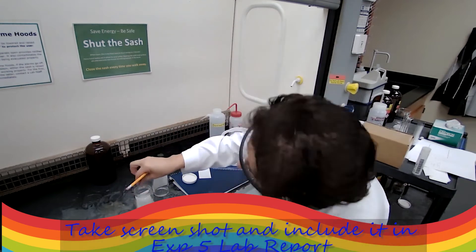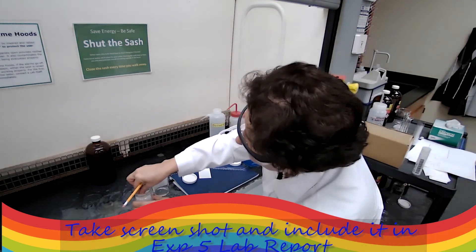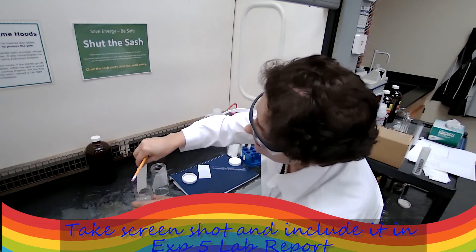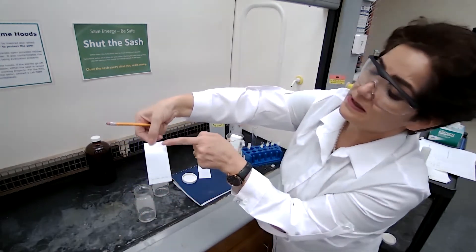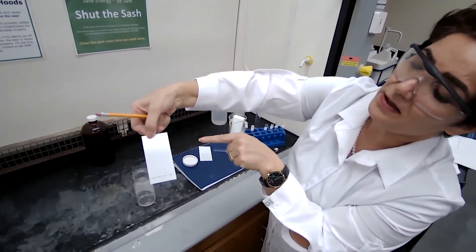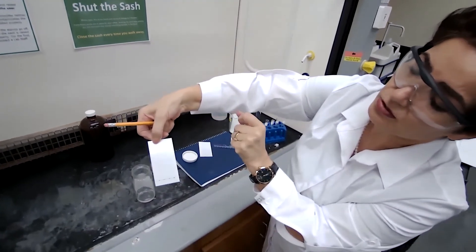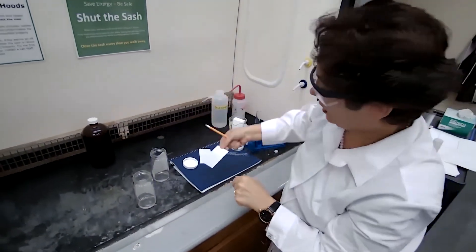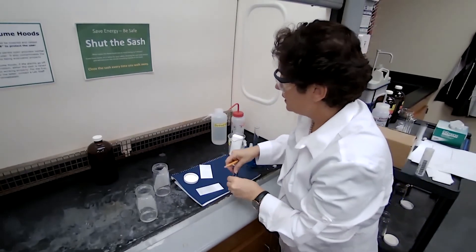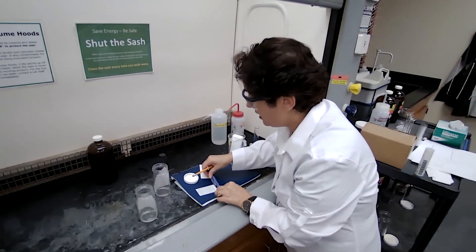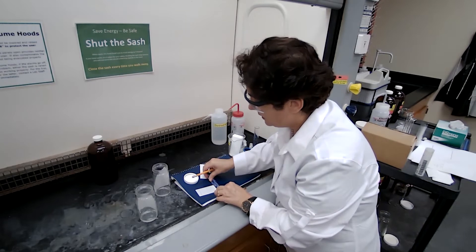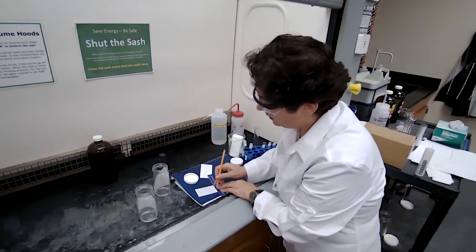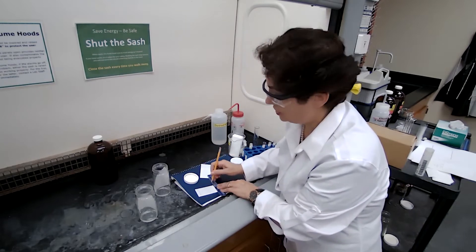The line is going to disappear. I would do the same for this plate. Remove, and you could see this separation now, the wet area versus the dry. But if you wait too long, that line would disappear and you cannot lose that line because that is the solvent front we are using for our calculation.